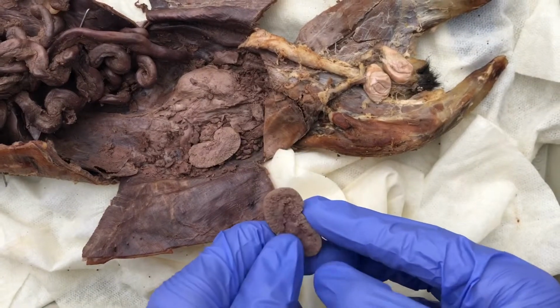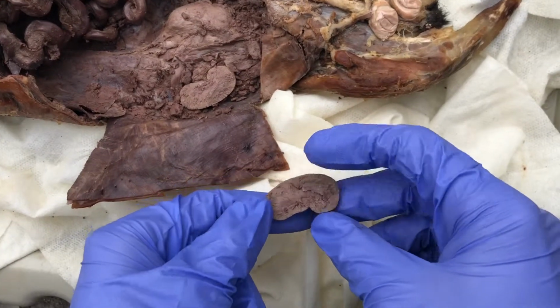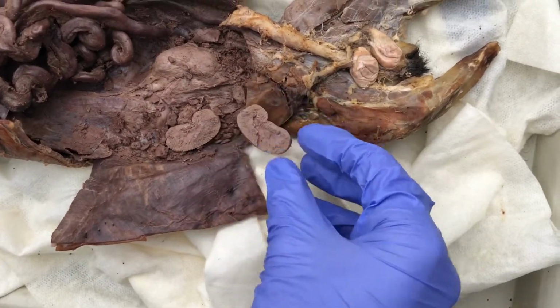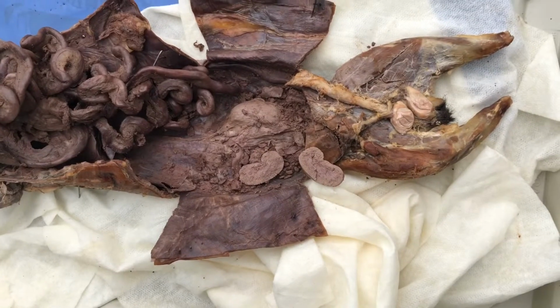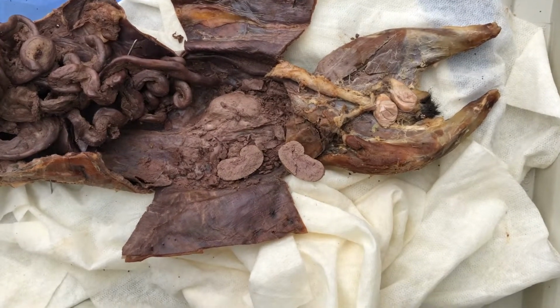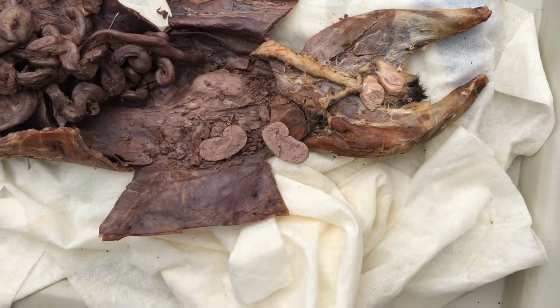All right, so in here we have the kidney, and we have the outer wall, which is the cortex, and then inside is the medulla. And within the medulla is the nephron. The nephron contains the glomerulus. The glomerulus filters blood into the nephron and filters it into filtrate, which is what contains all the toxic particles. And their particles are selectively or completely reabsorbed back into the blood.